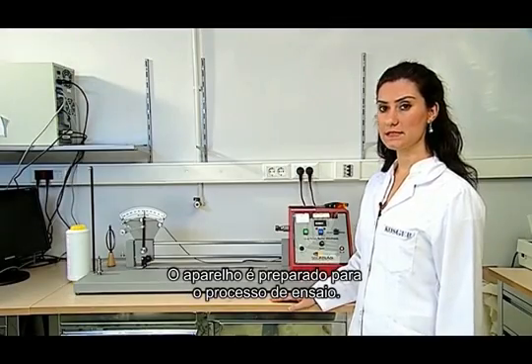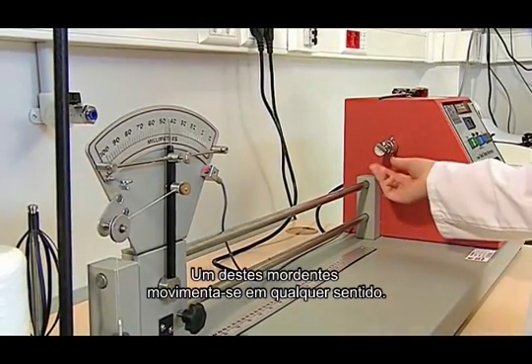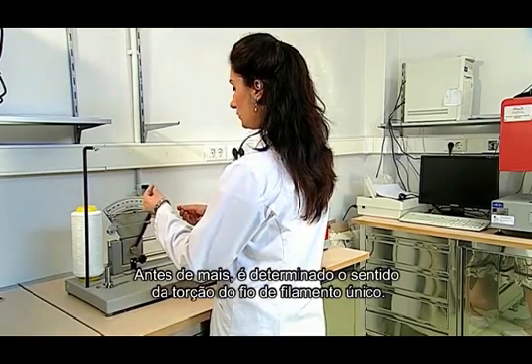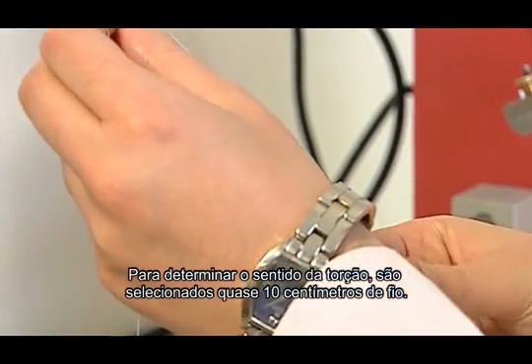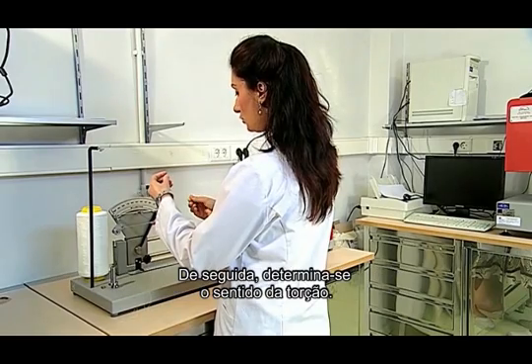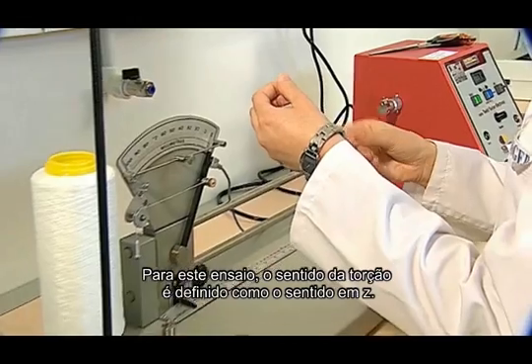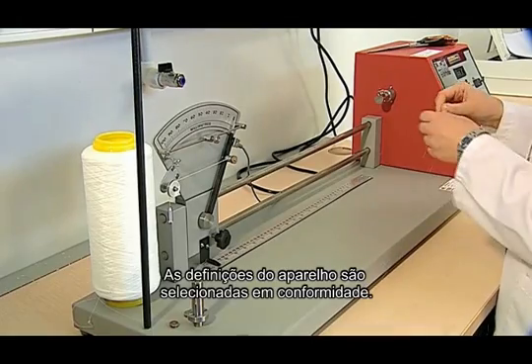Firstly, we prepare the device for the testing process. The twist measuring device has two nippers. One of these nippers is capable of moving in either direction. Primarily, we determine the single ply yarn's twist direction. In order to determine the direction of the twist, nearly 10 cm of the yarn are hung down and used. Then, it is determined whether the twist direction is to the left or to the right. For this test, the twist direction is determined to be Z direction. The device settings are set accordingly.